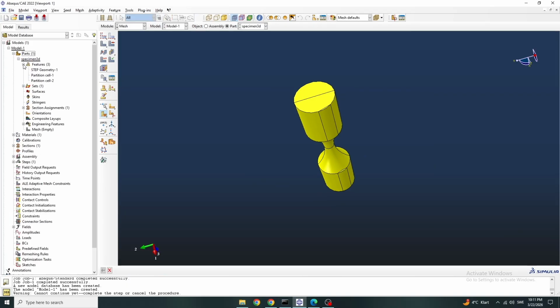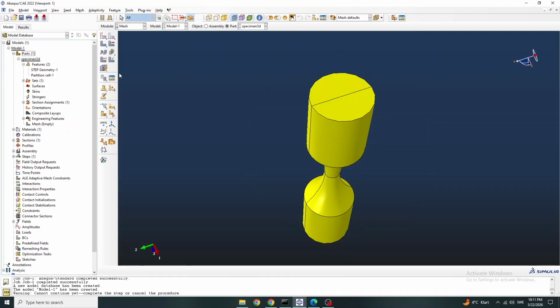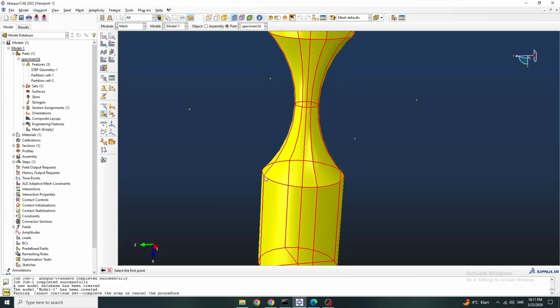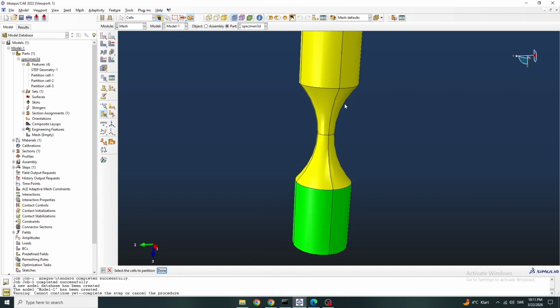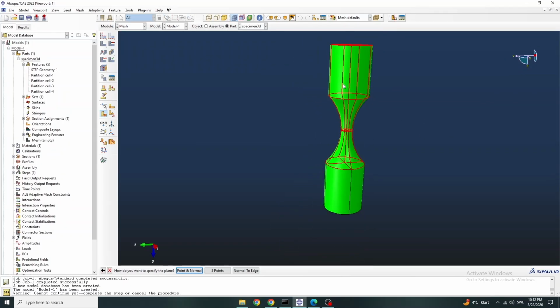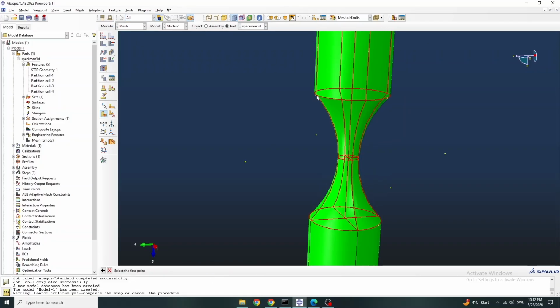If you do it wrong, you can go to features and delete. One more try. You go normal to point, and normal to that, and then maybe another 3 points: 1, 2, 3. Let's try for this one, 3 points: 1, 2, 3, and maybe for this one as well. It's already green, but let's stay symmetrical.